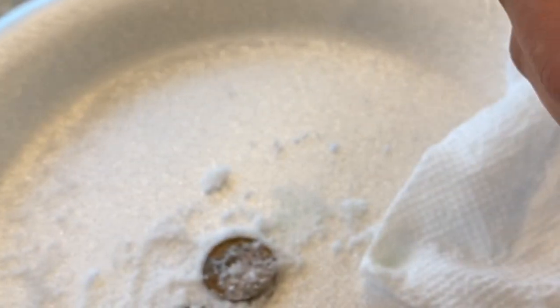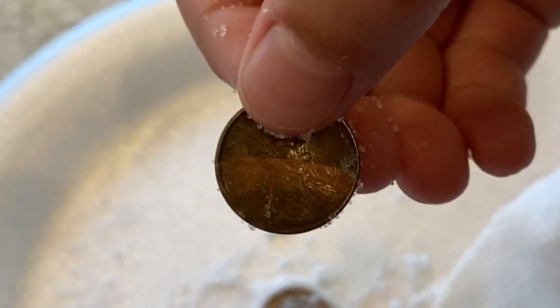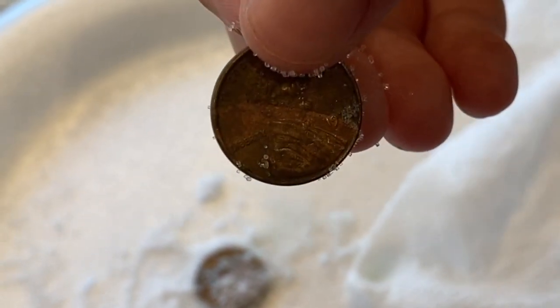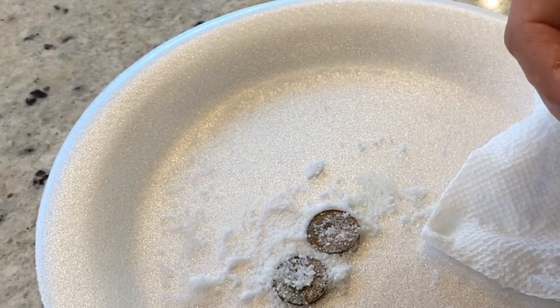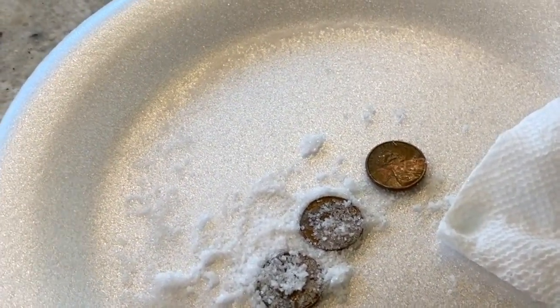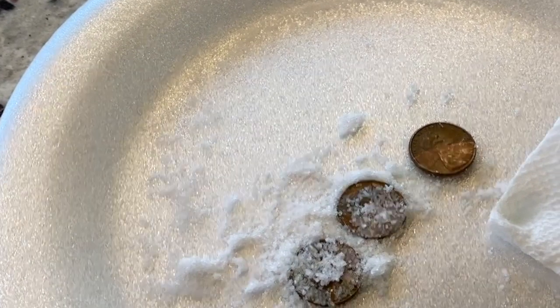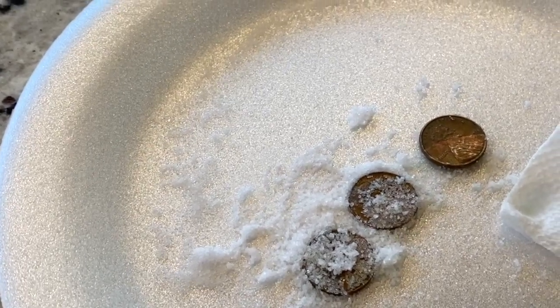What do you observe as far as the color? It looks tarnished again. I see a little bit where it was copper from yesterday when we put it in the lime — it's still a little lighter, more copper color — but I do see that it's becoming a little more tarnished. In the first part of the experiment we had the bright copper color appear after having them in the lime. Today, after having salt, water, and air, they're starting to tarnish again. Record those results in your book — those are the two chemical reactions we were able to see. Thanks for joining us.